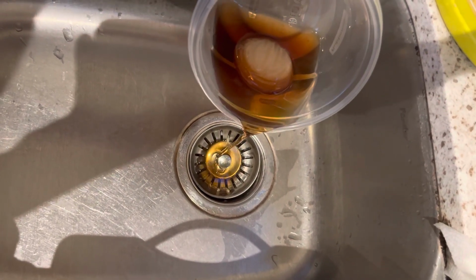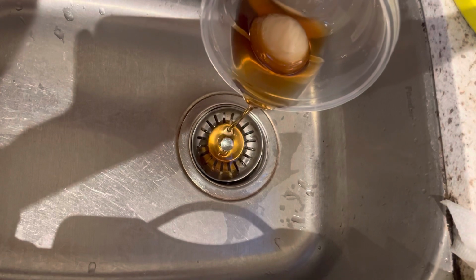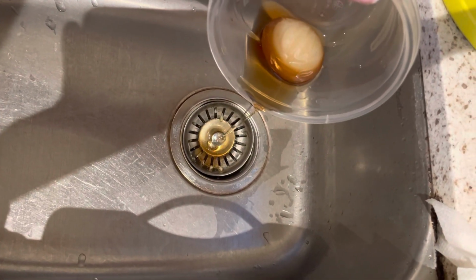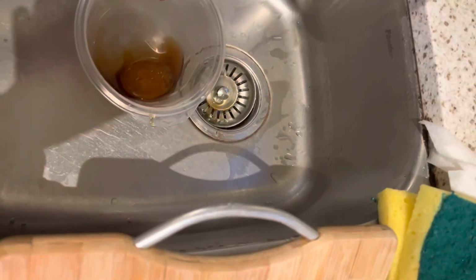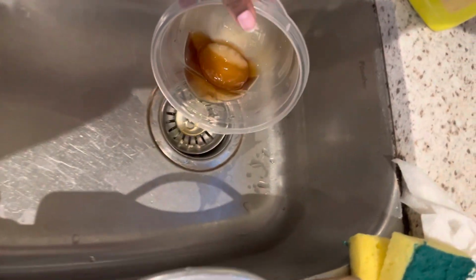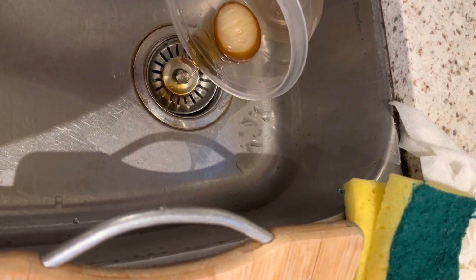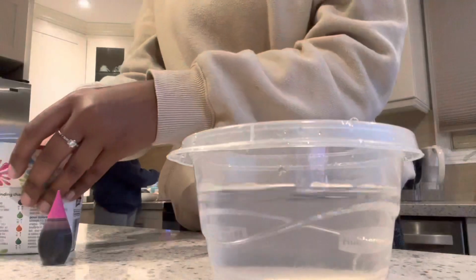This part of the experiment is very similar to a grape and a raisin. A raisin loses water, which makes its shape shriveled, but it tastes sweeter because there's a higher concentration of solute, which is sugar. Unlike a grape, which has a full shape because it has a higher concentration of water, but a less sweet taste.